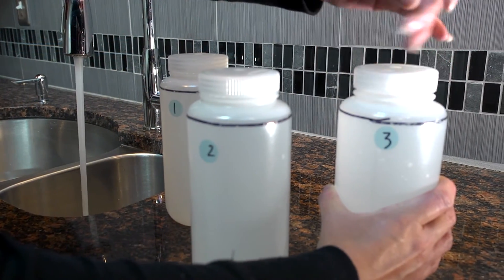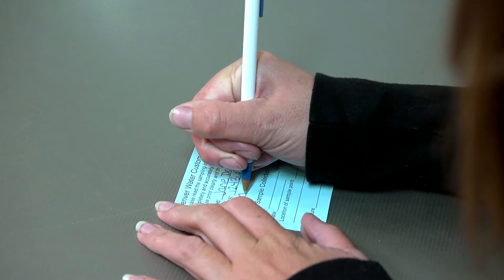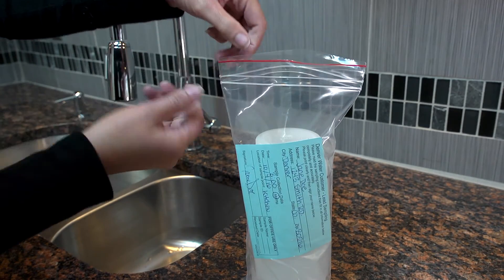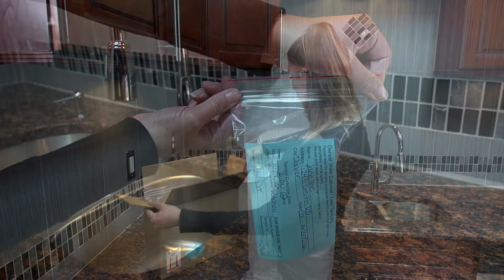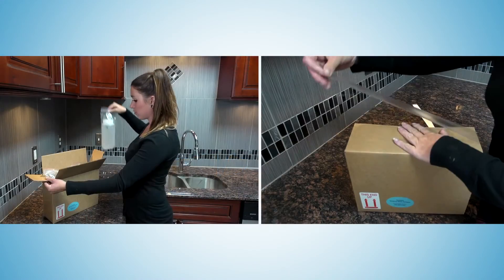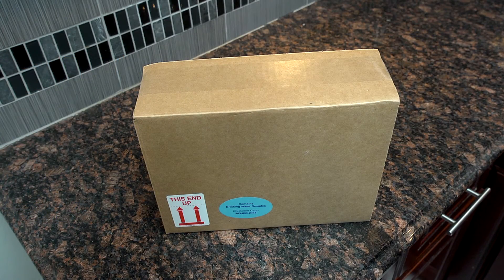When you're done, make sure the lids are on tight. Fill out the blue information card. Place the first bottle into the plastic bag and seal it with the blue card inside. Put the remaining two bottles in the other bags and seal them. Place the bottles upright in the box and tape it shut. Follow the instruction sheet to schedule a pickup and we'll cover the shipping cost.